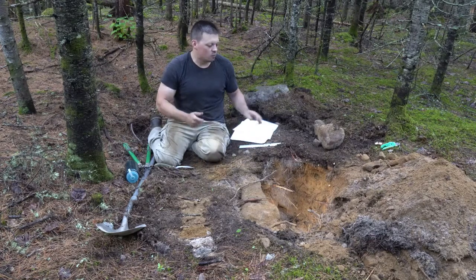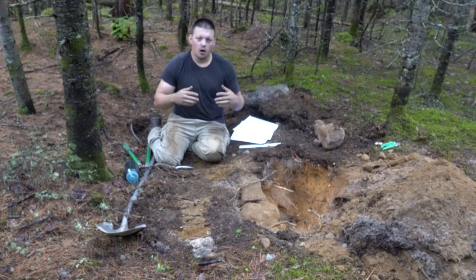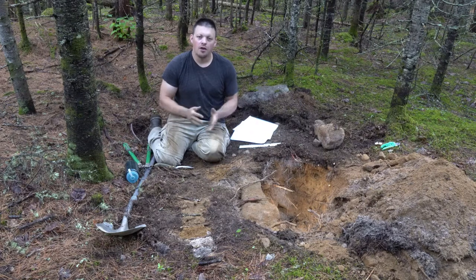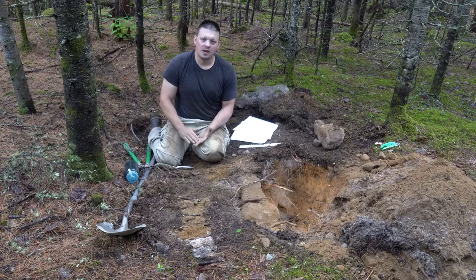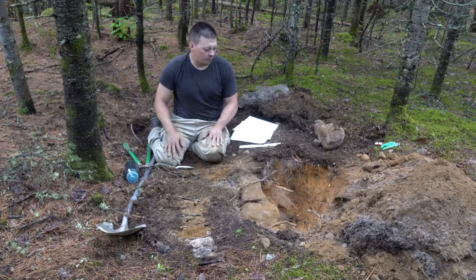These sequence of videos will walk you through how we identify our site and how we complete our soil transect or our transect and soil pits for the outdoor lab component of the soils course. For the indoor lab component, we will get into more detail on our physical properties. In the lab, we'll determine soil pH, texture, organic matter content, our nutrient concentrations to build on all of this information. We do that on a horizon by horizon basis.